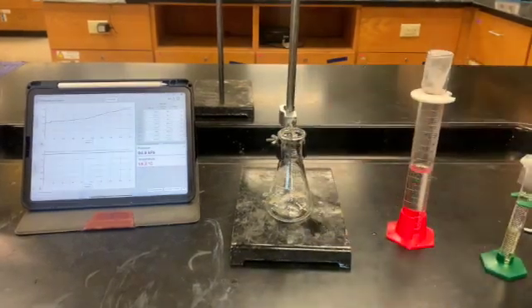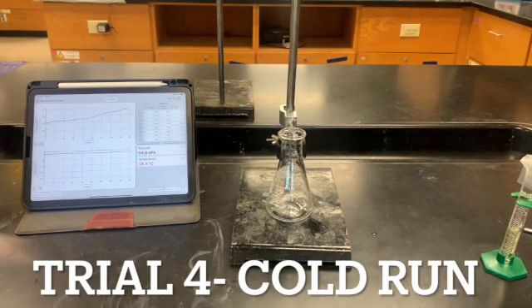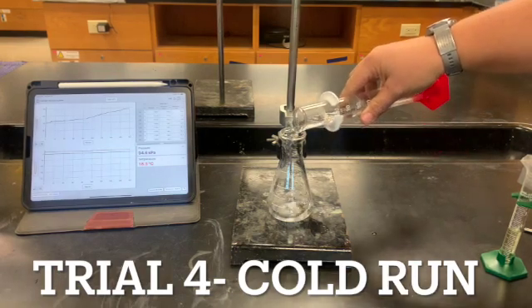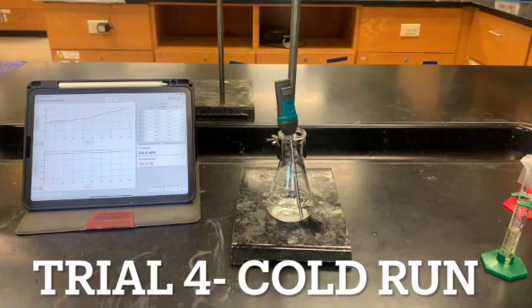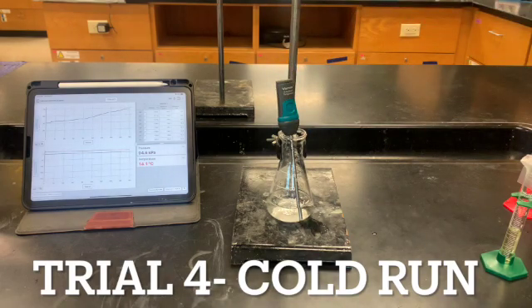All right, the last run is gonna be our 10 degrees at least underneath our starting temperature. So here's my water, and I'll have 45 milliliters of water. We'll get a starting temperature of that, and hopefully we've dropped it. Okay, it'd be preferred if you do an ice bath instead of I just had it in the fridge. All right, but we're gonna at least shoot for at least 10 degrees below.